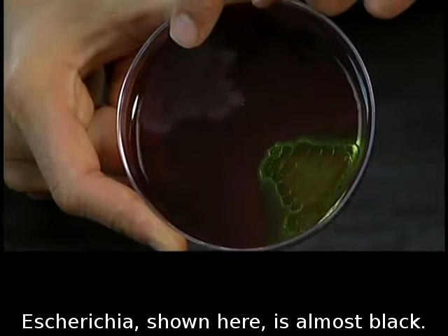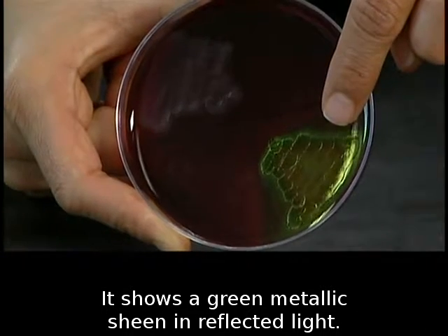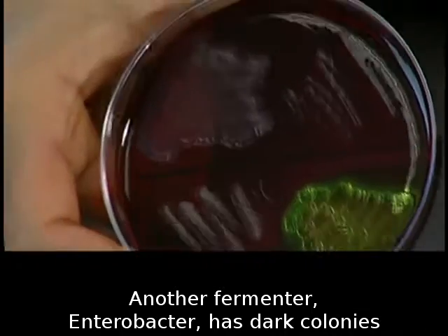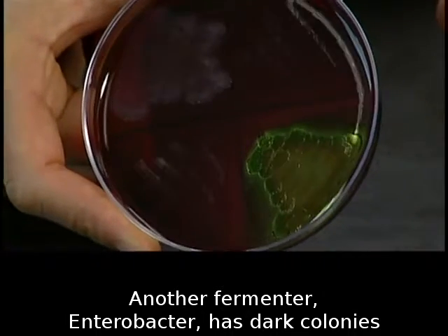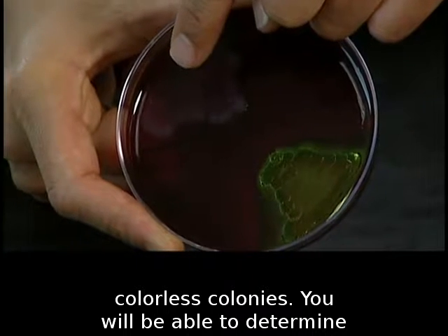Escherichia, shown here, is almost black. It shows a green metallic sheen in reflected light. Another fermenter, Enterobacter, has dark colonies with a light border. Non-fermenters will have colorless colonies.